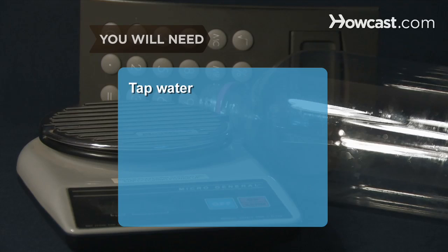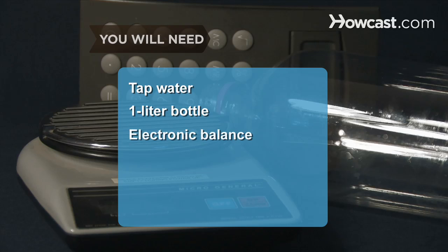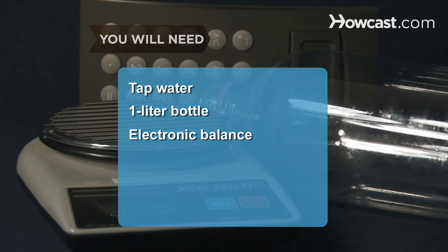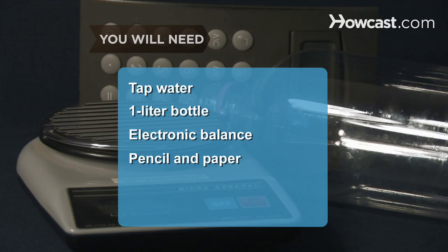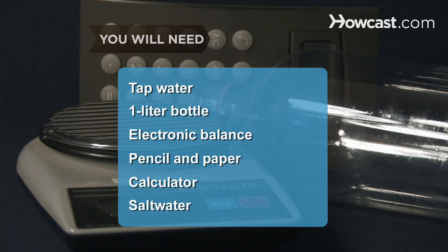You will need tap water, a 1-liter bottle, an electronic balance, a pencil and paper, a calculator, and saltwater.